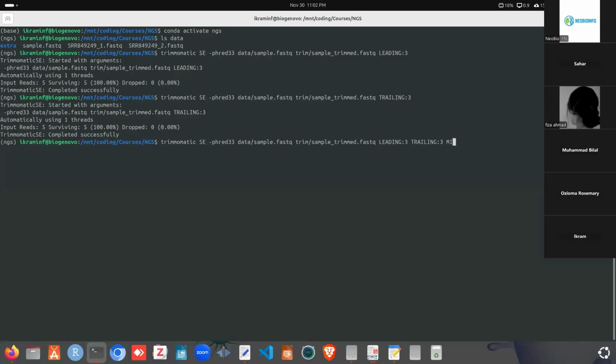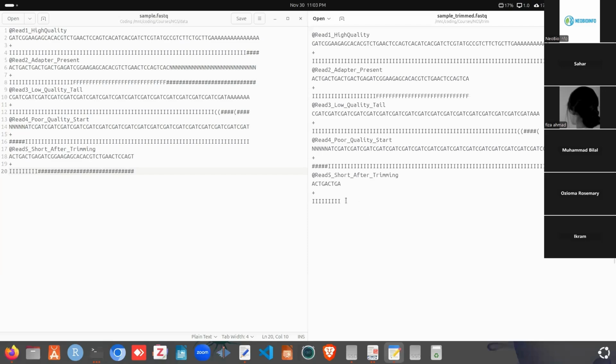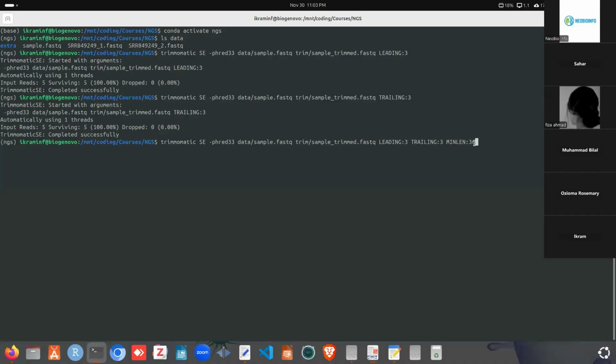Now we can check the min length command. We need to specify the minimum length. So if we run this, minimum length is actually applied after trimming. After performing the trimming, the read has some length. If we see this read, it has length 9. So what length will we specify in here? 36. If the length is less than 36, the read will be dropped.